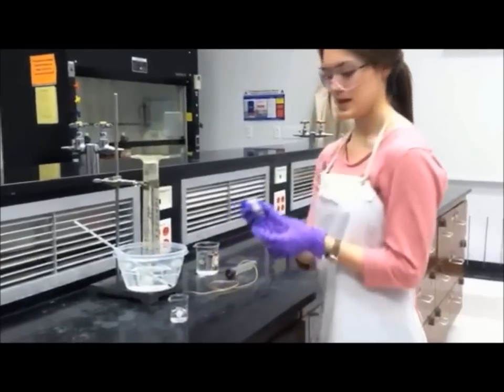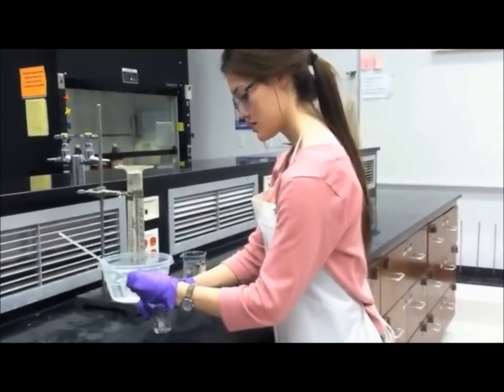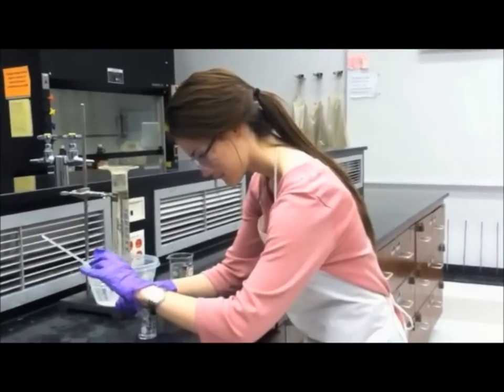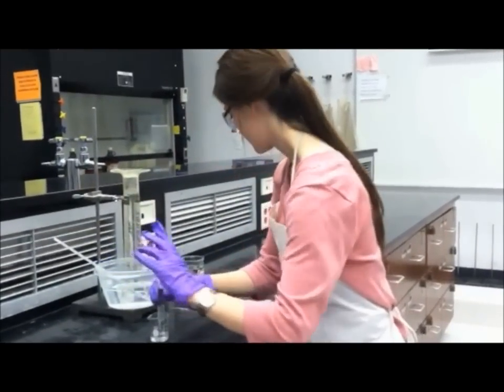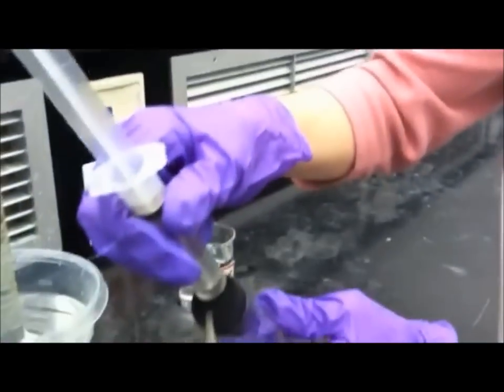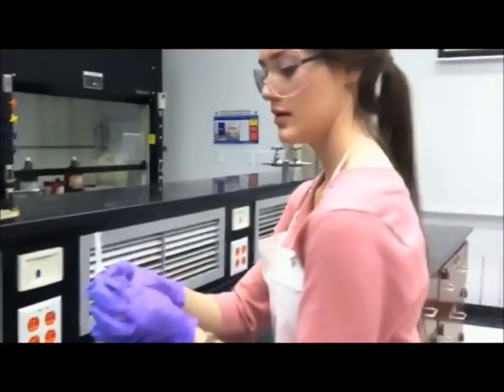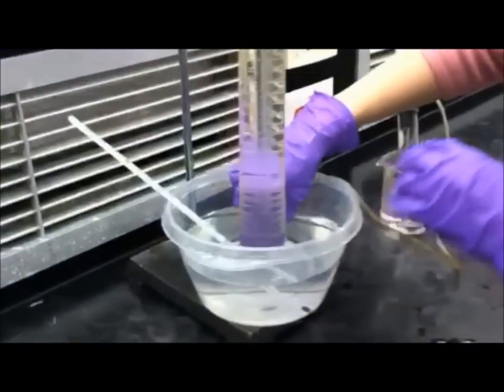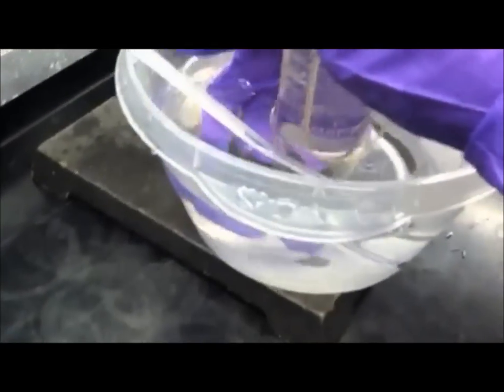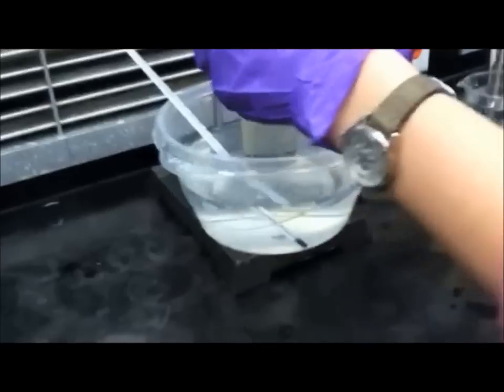So now we will fill the syringe with exactly 10 milliliters of the hydrochloric acid. And then you will place this into the second hole in the stopper and set this in here. Very carefully, feed the tube up into the graduated cylinder. If the tube falls out, it could give inaccurate readings and volume.